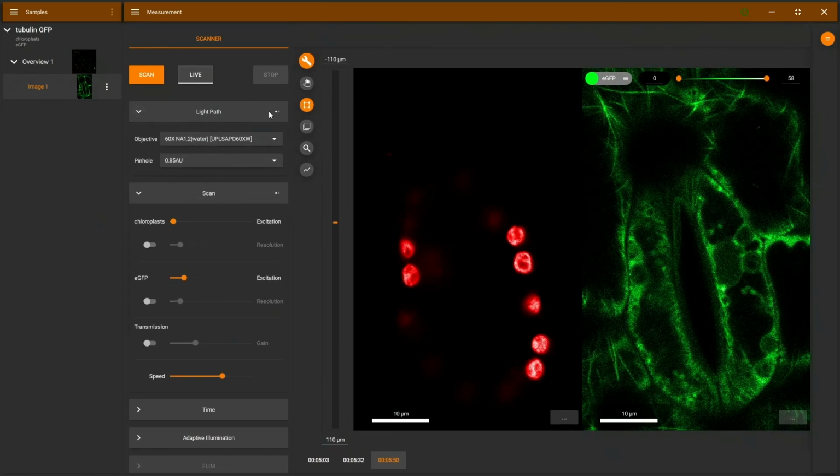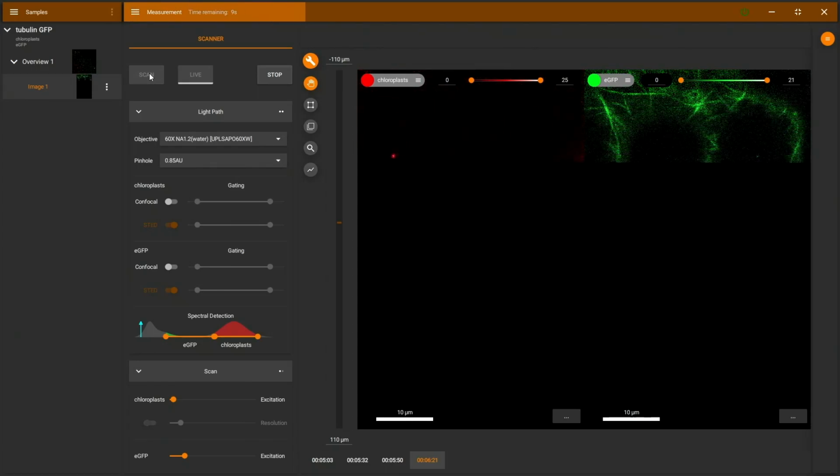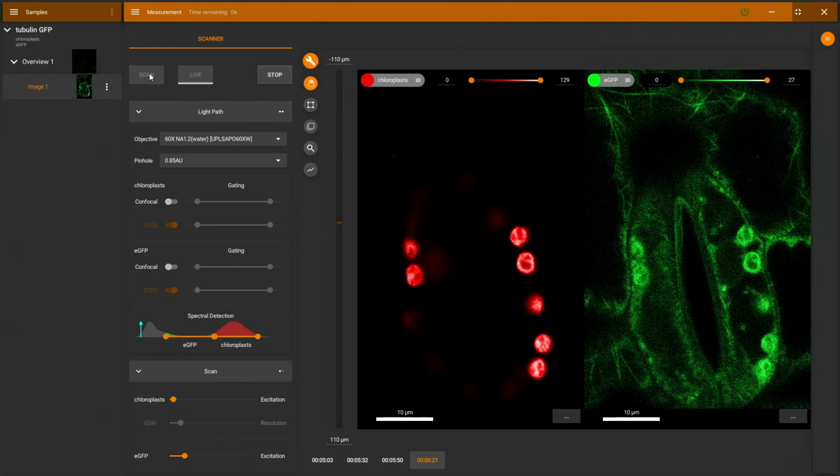Now, if I go to light path and expand that menu, I can now adjust our spectral range for the two detectors here. I'm moving the GFP fluorescence to a longer wavelength range, meaning our GFP fluorescence will be much weaker, but I will also now catch a lot more autofluorescence from chlorophyll. And here we can see really, really strongly our chloroplasts now, and they are in the GFP image where they shouldn't be. If I go to time gating here, I can now activate time gating, which I described earlier for the GFP channel.